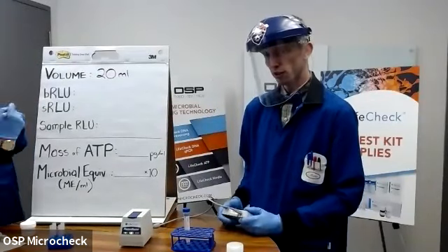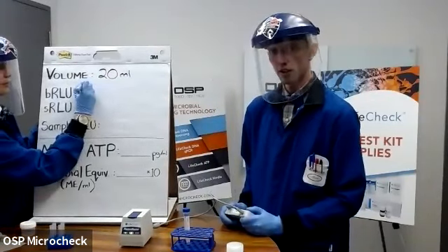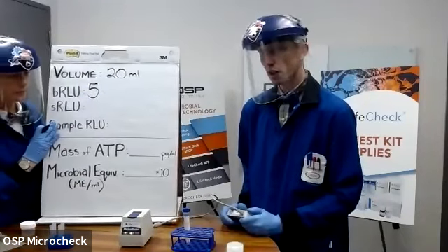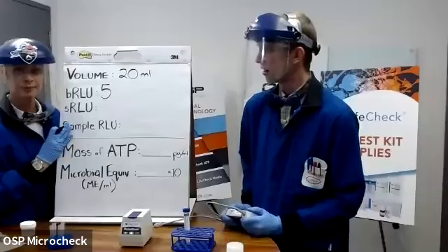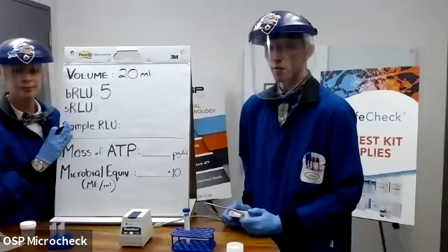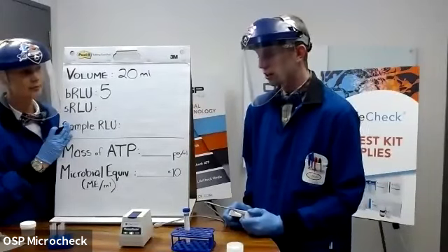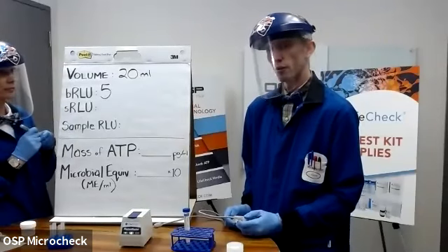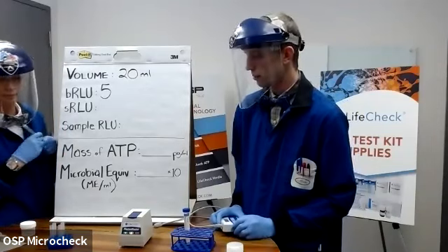So this is exceptionally low. This is where we would like to see a luminometer come up for a background reading in one of our assay tubes. If this was significantly higher, like on the order of maybe 30 to 40 or even into the hundreds, there could be a couple of different things that went wrong here, and you should stop at this point and correct or mitigate some of these things.